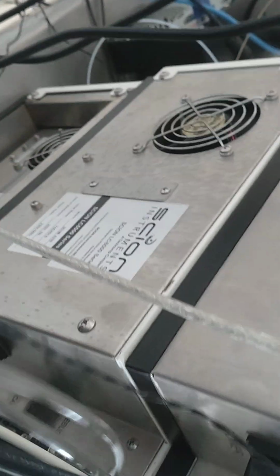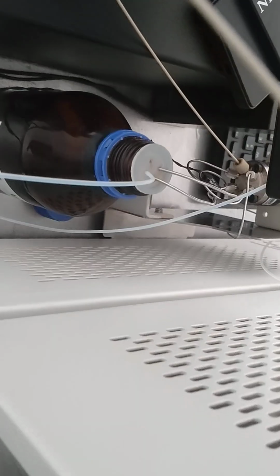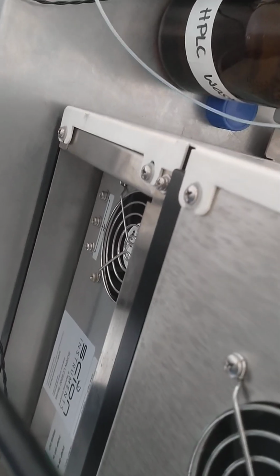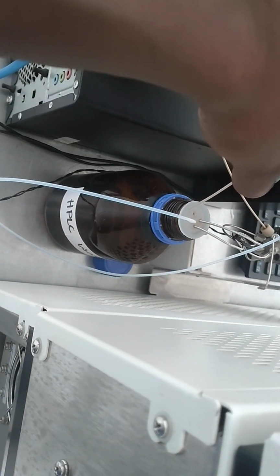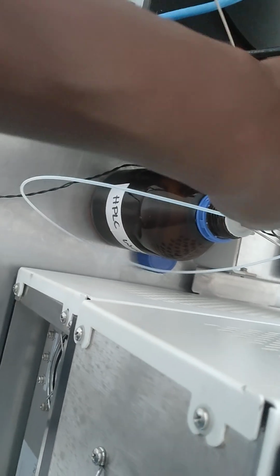Then we also have the valve, like this valve, and this is the manual injection valve. It comes here, until it is connected to the manual injection valve. And this is the recycle bin, of course, for this HPLC. This is the recycle bin.